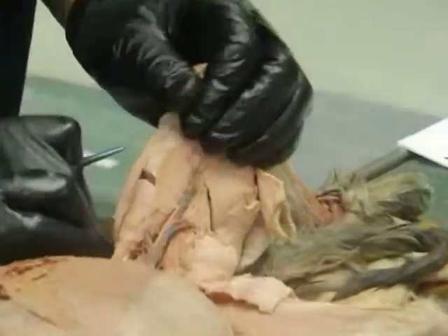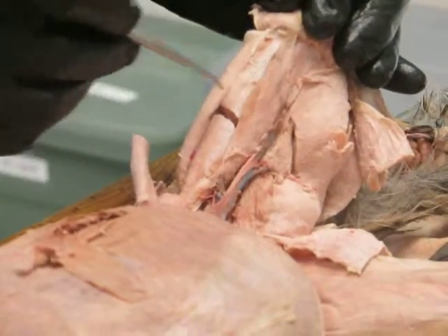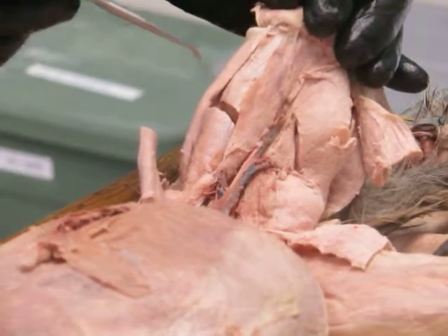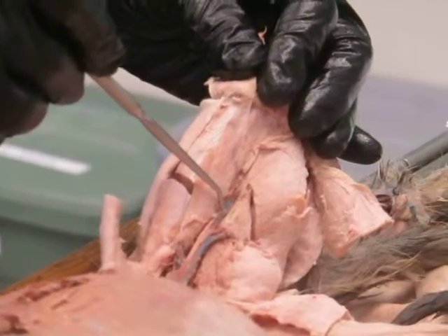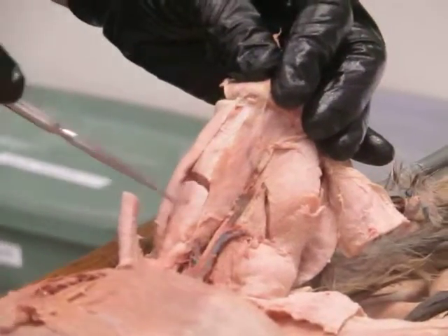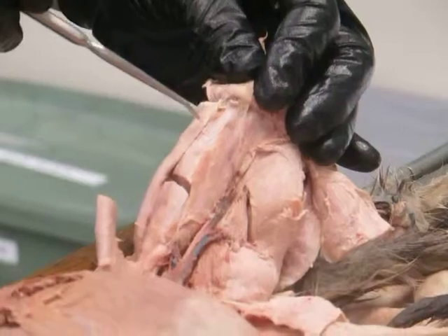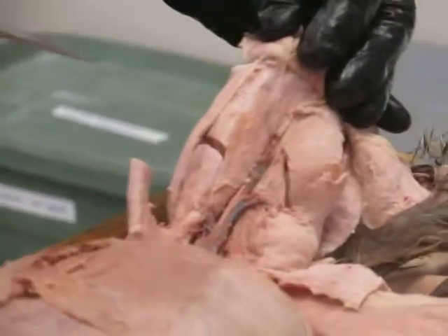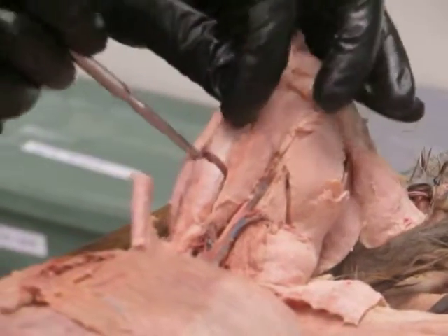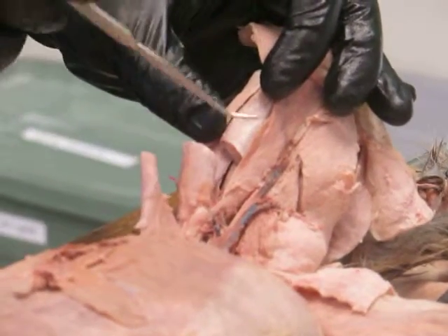And if we flip the sartorius back, we look on the front of the thigh, and there's a group of 4 muscles here that we're looking at on the front of the thigh. There's one on the medial side and one on the lateral side here. These are the vastus lateralis on the lateral side, and on the medial side, vastus medialis. This one that runs right down the middle is the rectus femoris, okay, which literally means the straight muscle, rectus femoris, of the thigh, the straight muscle of the thigh. And it's very kind of round in cross-section, so it sort of stands out from all the vasti.